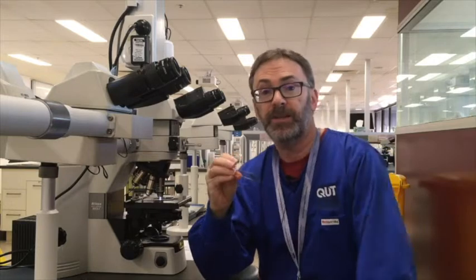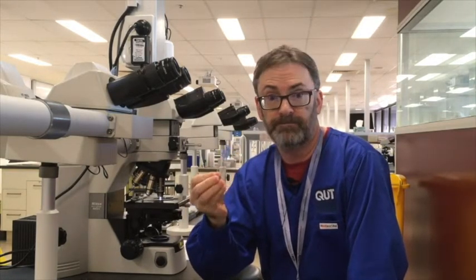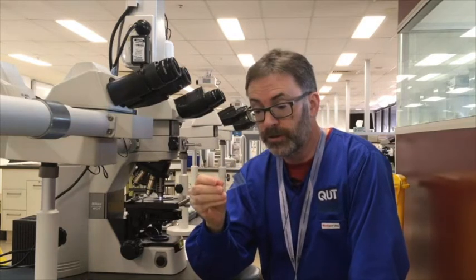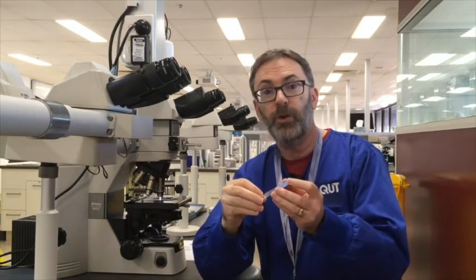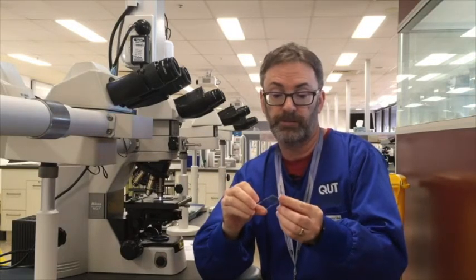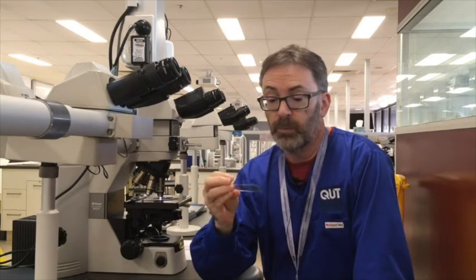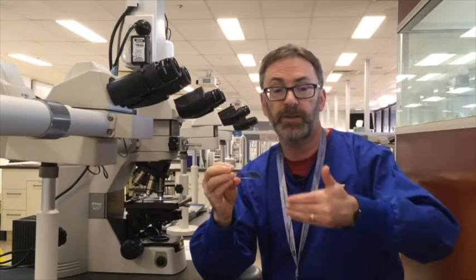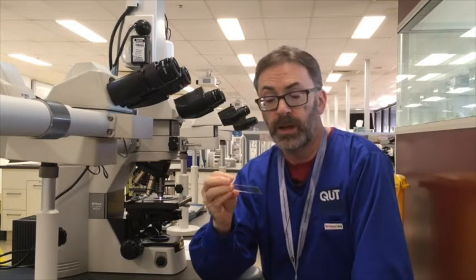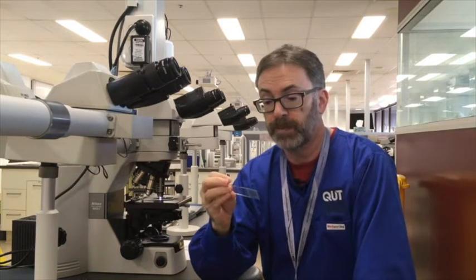So the first staining technique that you'll learn this semester is the H&E stain. Hematoxylin and eosin working together in perfect harmony to provide a general overview of tissue morphology. Every block of tissue that goes to a pathology laboratory will have a H&E stain. And even within the research setting, you'll often find that every block will again have a H&E stain section performed, just because it is how people are trained to interpret morphology.